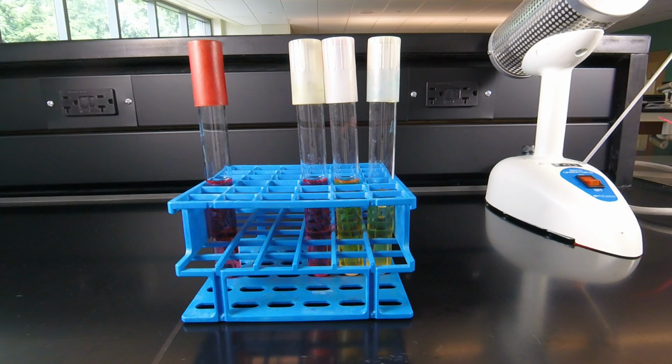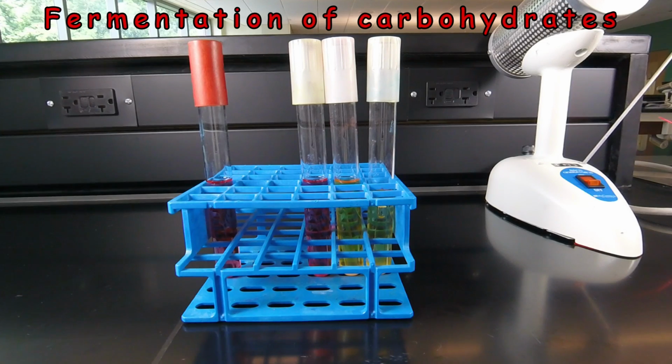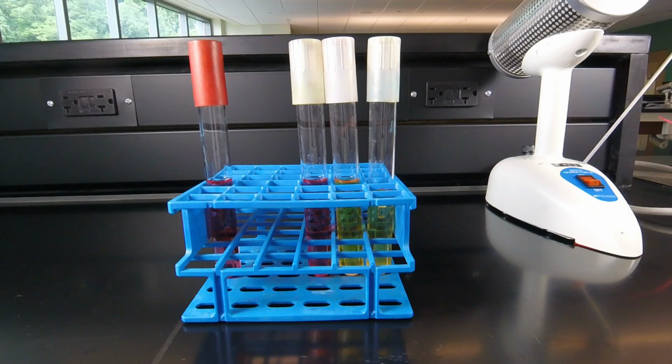One of the more common tests we use in bacteriology to help identify bacteria is to determine what carbohydrate or carbohydrates that organism can ferment, if any. In this particular lab, we're going to be using Phenol Red maltose and Phenol Red lactose broth.